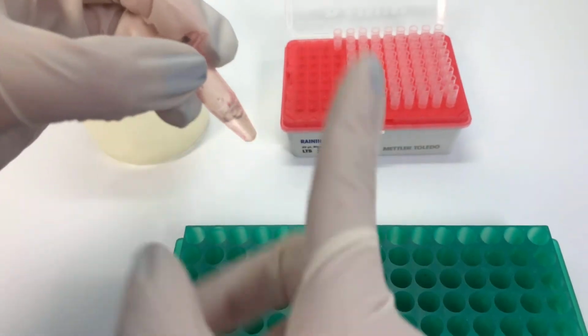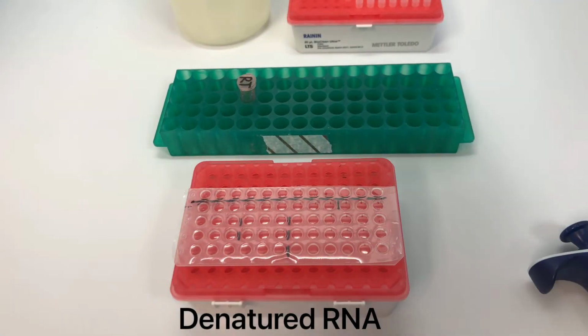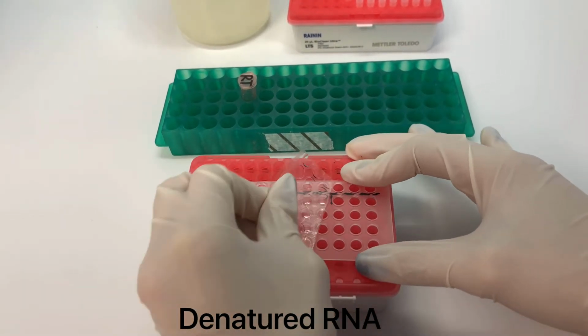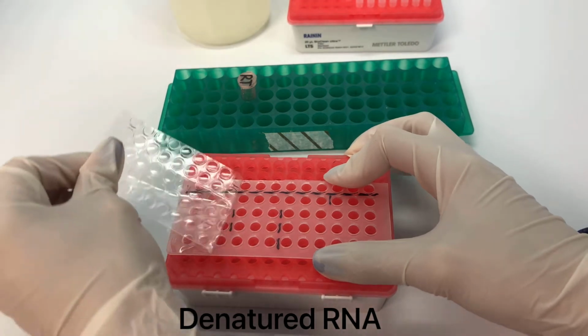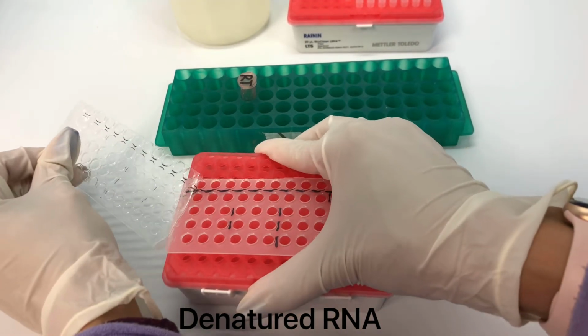Gently flick the tube to mix. After your samples are done denaturing, gently remove the plastic wrap from your PCR plate. Be careful to not splash the samples inside the wells.